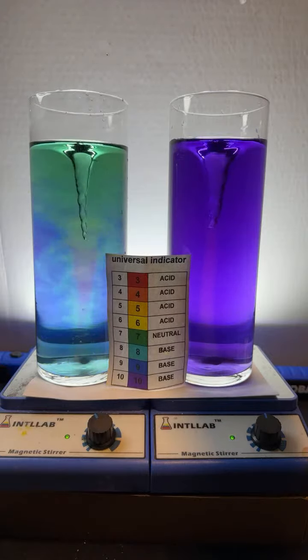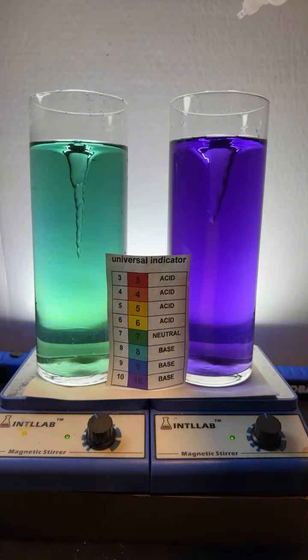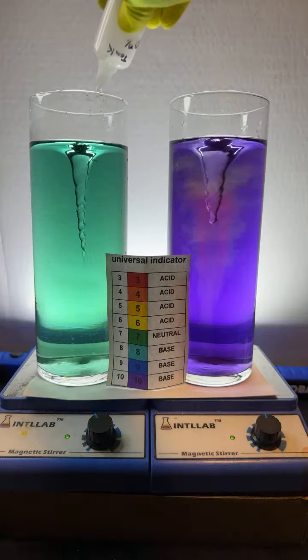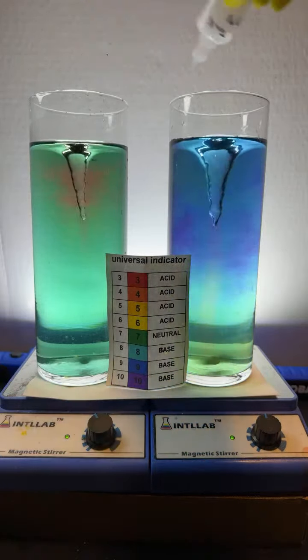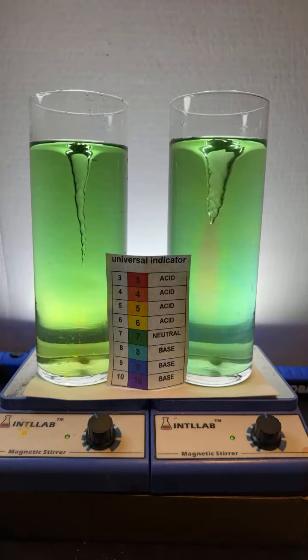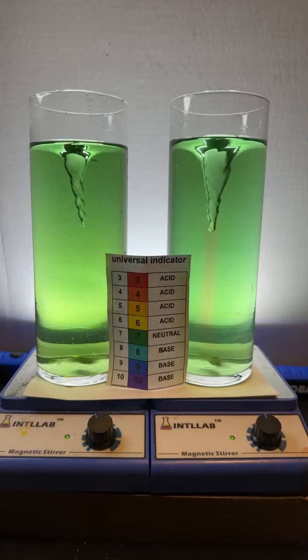What do you think of those stirrers? I do a reaction that is a slurry, and my mixer slows way down. I don't know, man. I don't know if this is going to do a good job of keeping things from getting gummed up, so to speak.